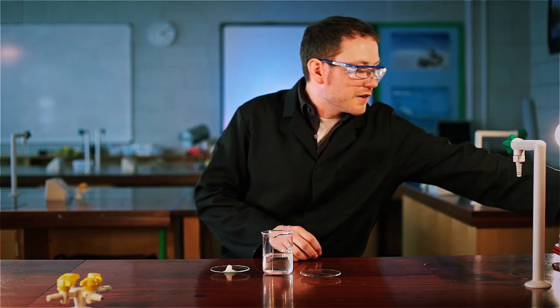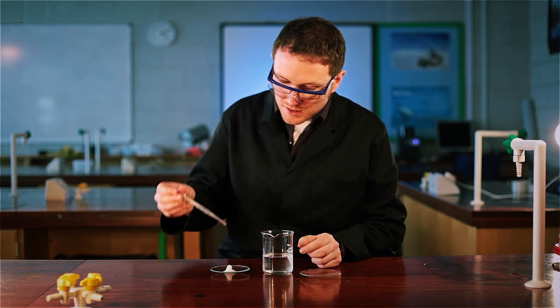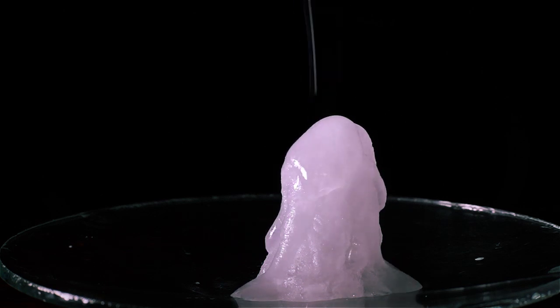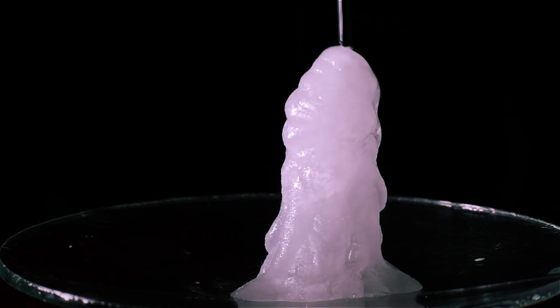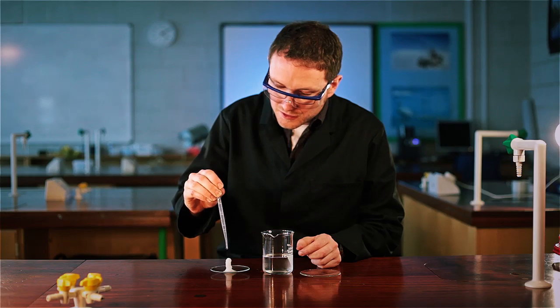Now, if you find that the end of your pipette begins to crystallize, that's a good opportunity to have some other ones nearby because you don't want to then get any solid anywhere near your original stock solution.